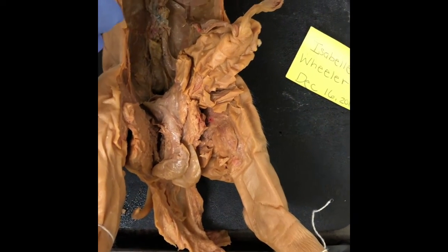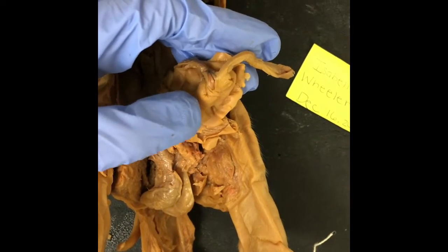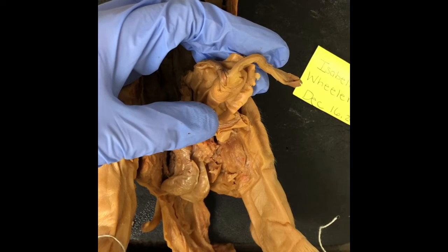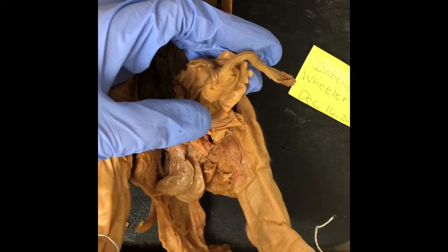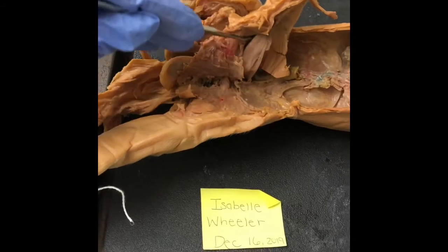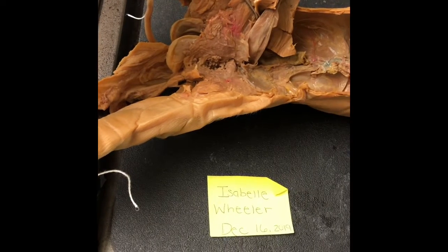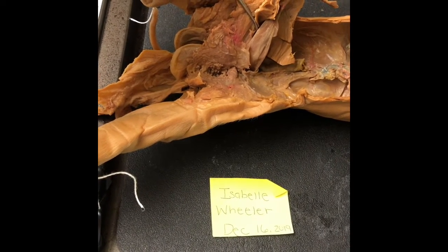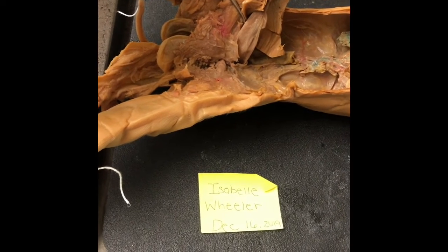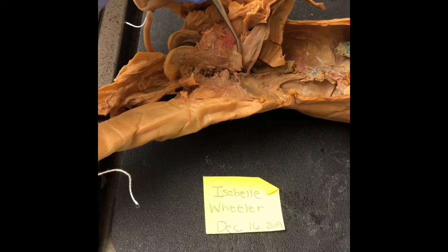Then we have the urogenital opening, which is located right there below the umbilical cord. And it is where the bodily waste and reproductive fluids are expelled to the environment outside of the body cavity. We have the penis right here. The penis contains 2 chambers, the corpora cavernosa, which runs the length of the organ. So these 2 chambers are filled with spongy tissue and surrounded by a membrane.